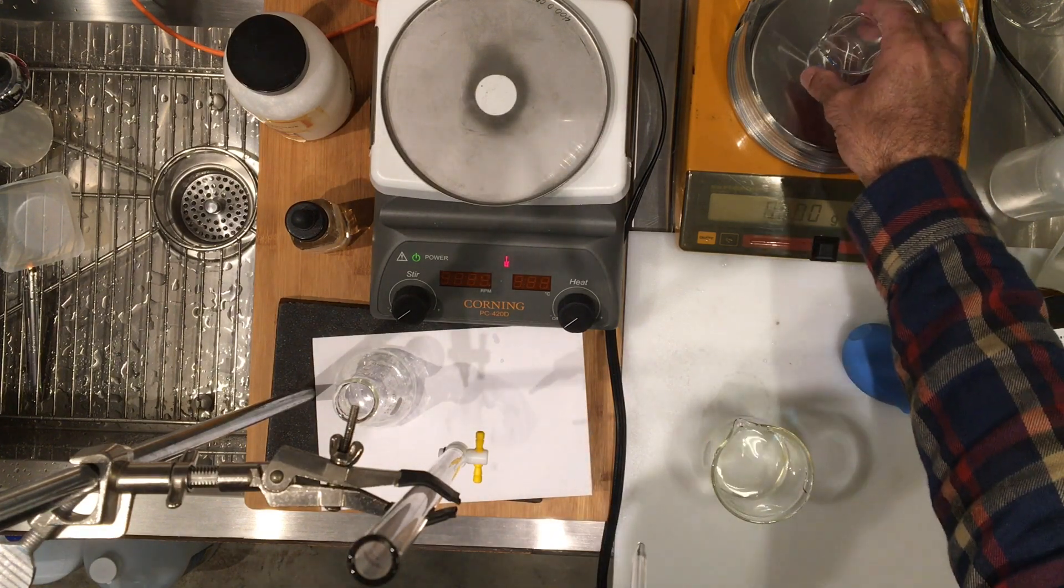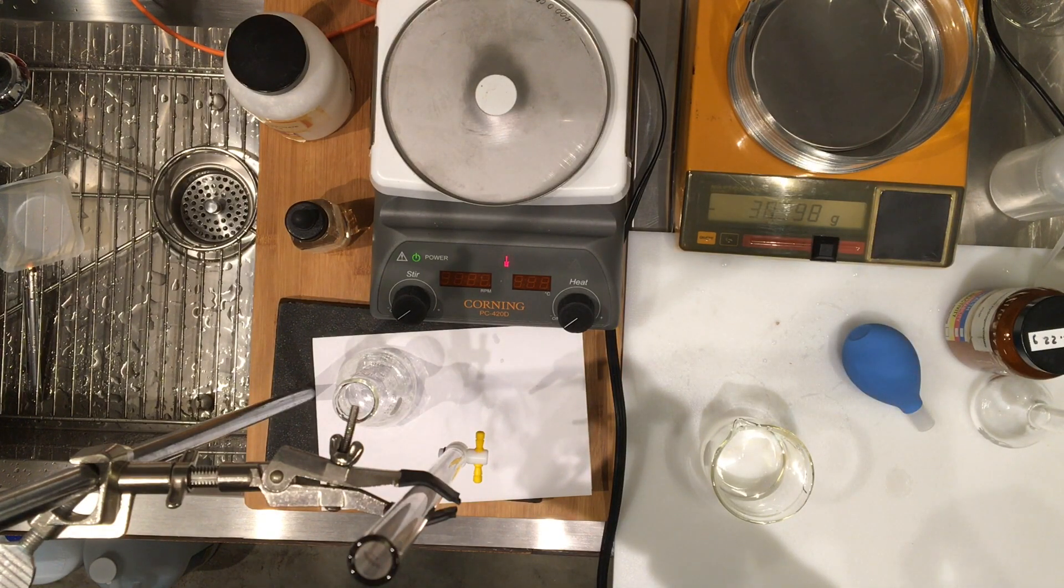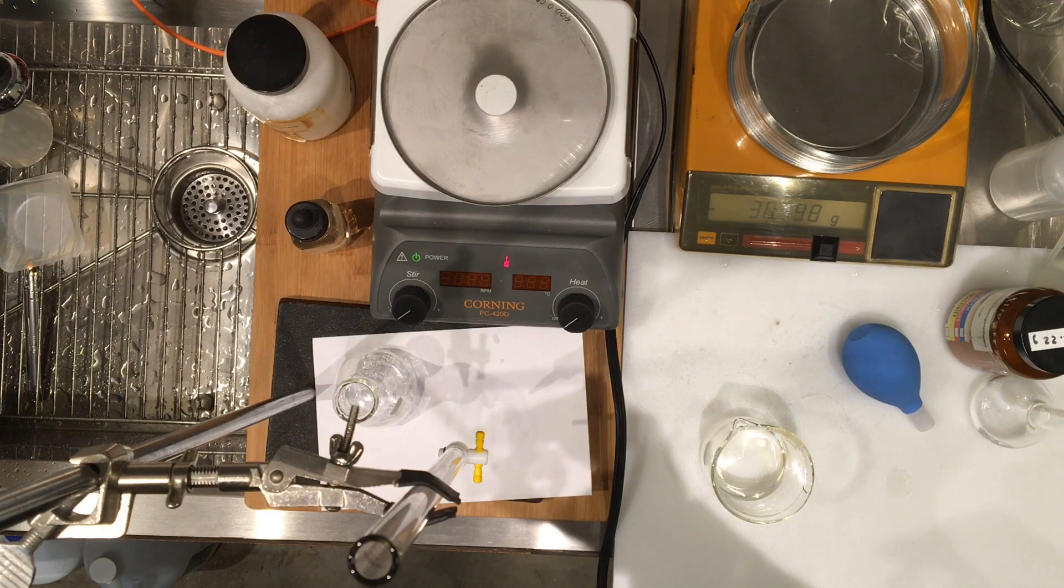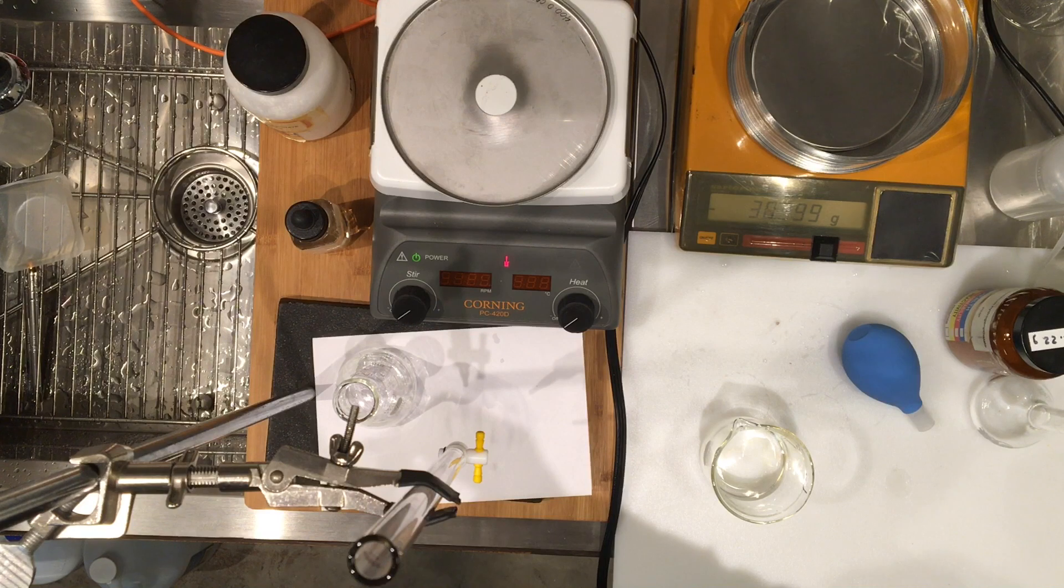So I'm going to transfer the 20 milliliter into this little beaker that was dry, clean and dry, and its mass was zeroed out. So let's go ahead and write that down.